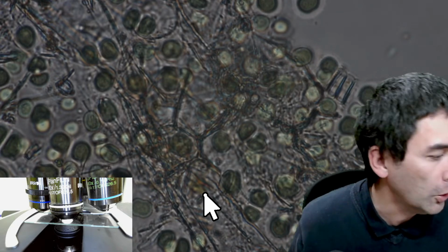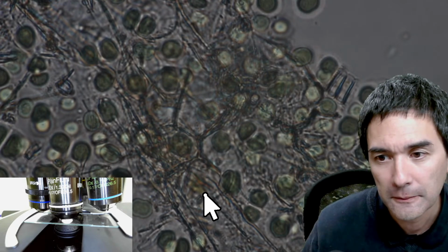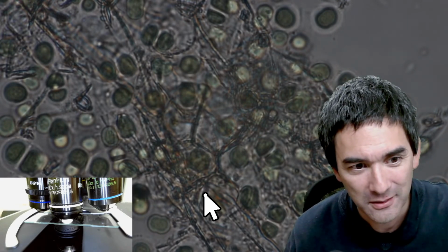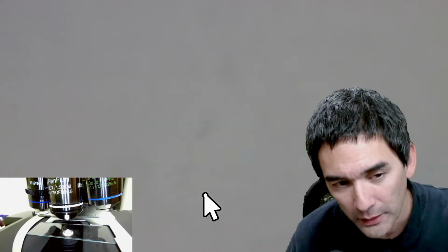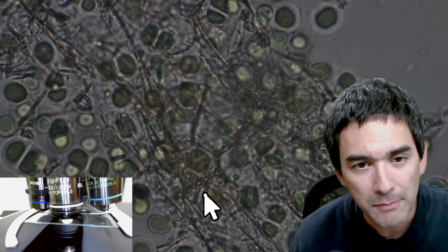I'm going to now lock the lever. So I've locked it now, and look what I can do now. I can now lower the stage, and then when I raise it again, I'm using the coarse focus knob, I raise it again all the way to the top until it blocks, and I'm back in focus. So that's really nice. This basically means I have a much easier time applying the immersion oil, and then I simply rotate it up again, and it's back in focus.